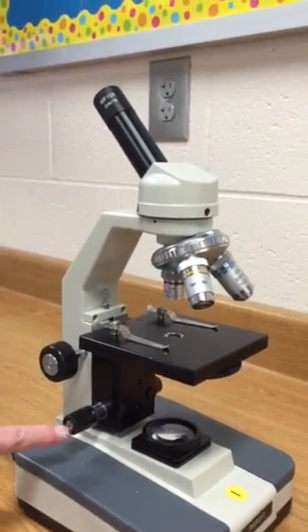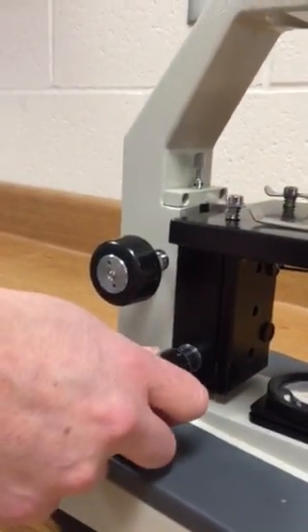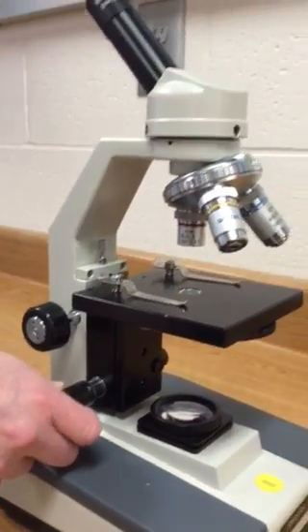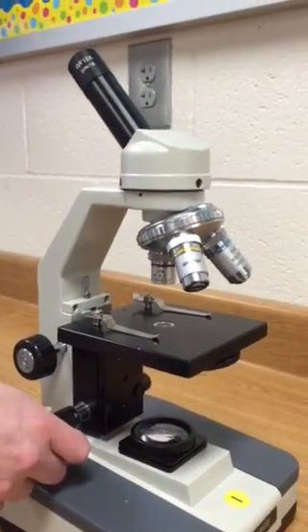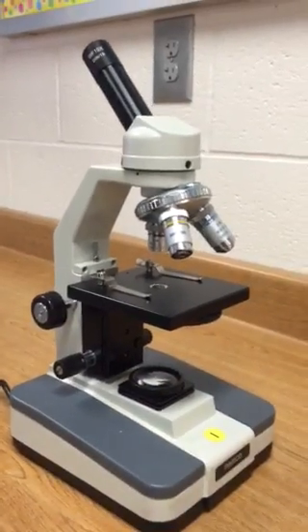The small knob here is the fine adjustment knob, which you don't need to move very much — just tiny little movements to fine-tune your specimen.